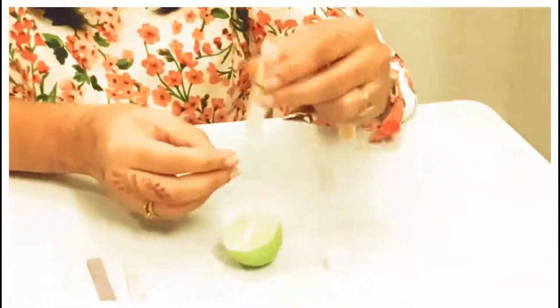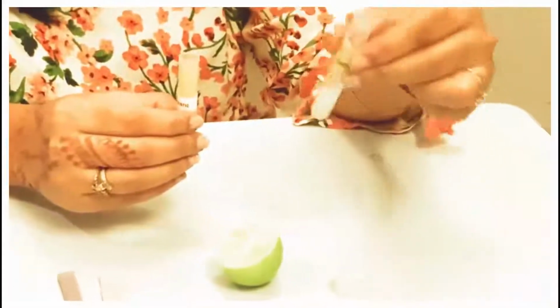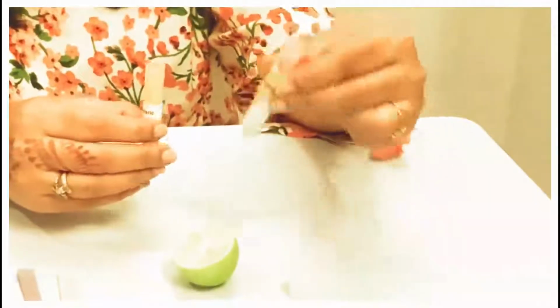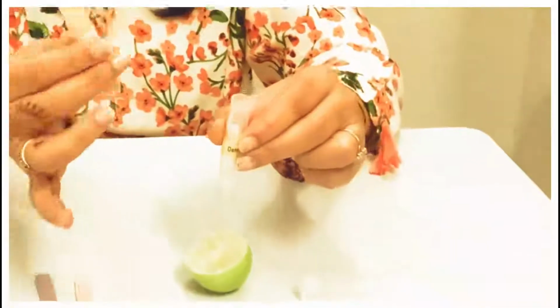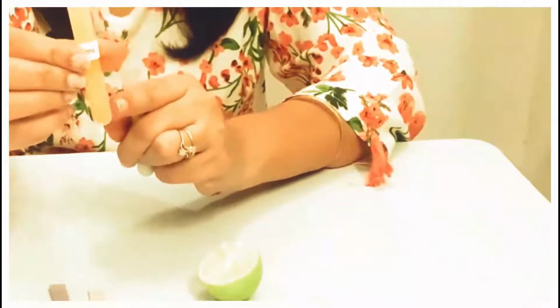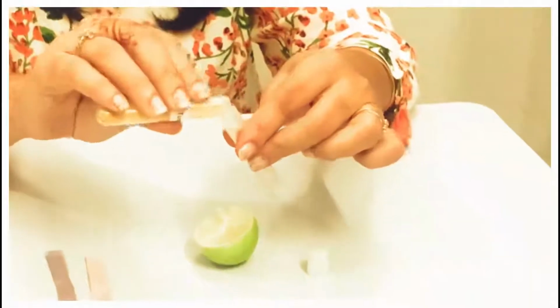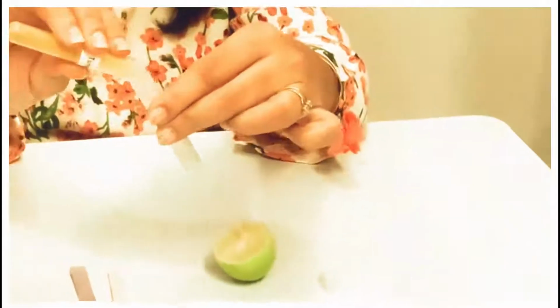I am just making a solution of detergent here, so that I will get a perfect test. And now I will add a small amount of turmeric. Here there is no need to make the solution of turmeric. I can use it in the powder form. I'm just putting a small amount of turmeric in this detergent.